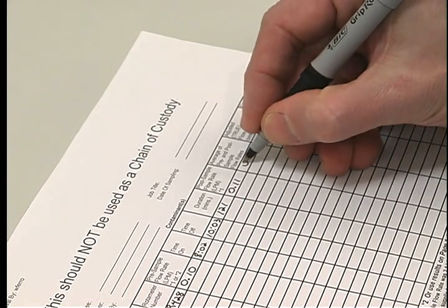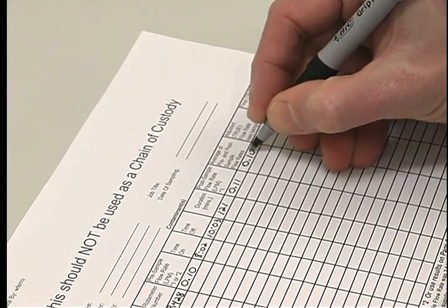If they are, average the flow rates to determine the flow rate to be used to calculate the air volume.